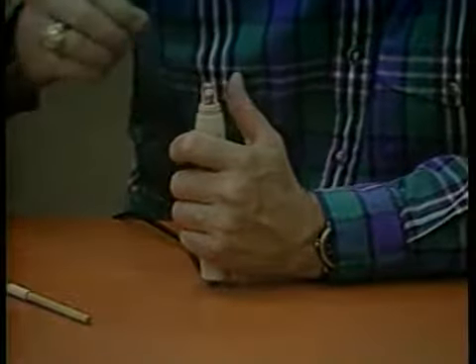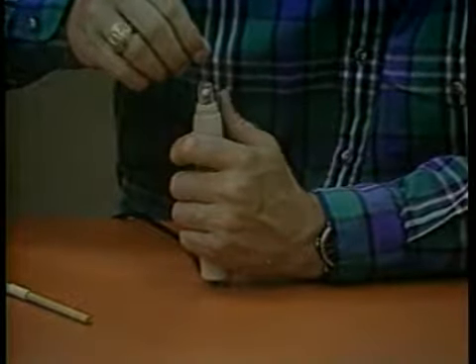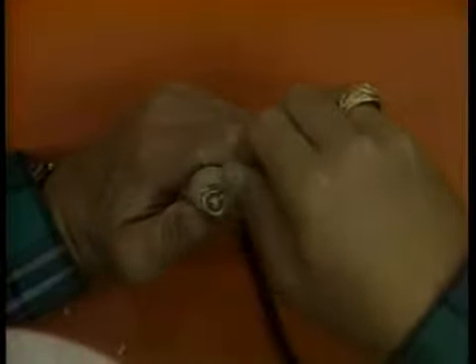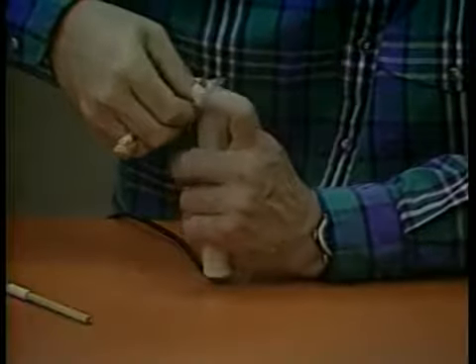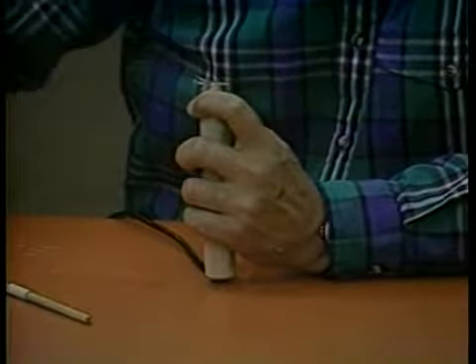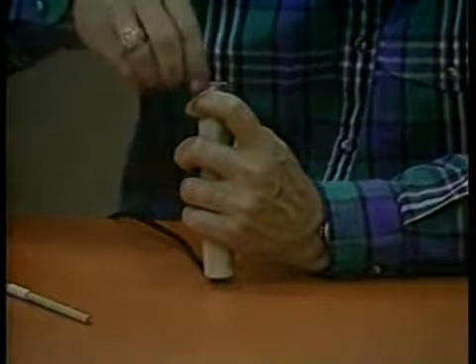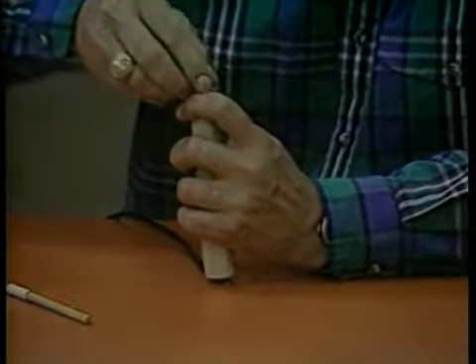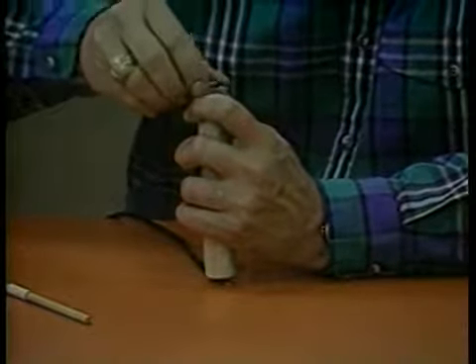Place a new membrane over the sensor, and while holding one end with your left thumb, pull the other end up and over the sensor. Stretch the membrane slightly as you pull it over the sensor. This usually requires some practice before you can put the membrane on without leaving any air bubbles. If no air bubbles are present, replace the O-ring and trim off the excess membrane.